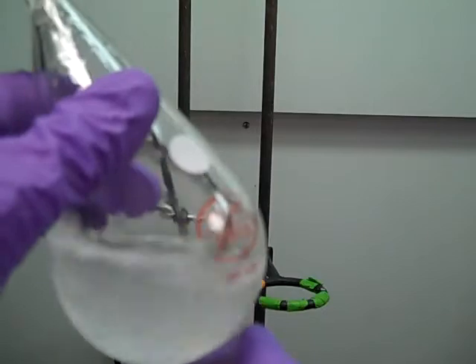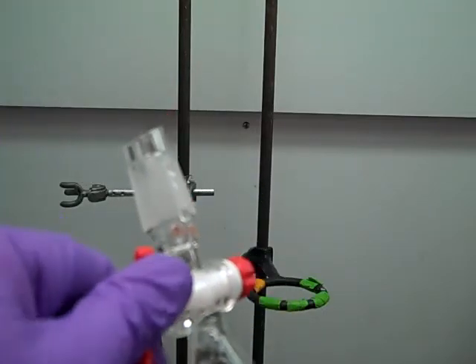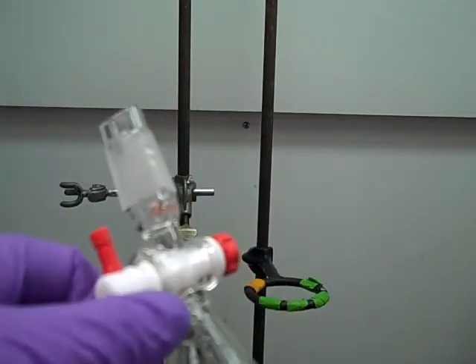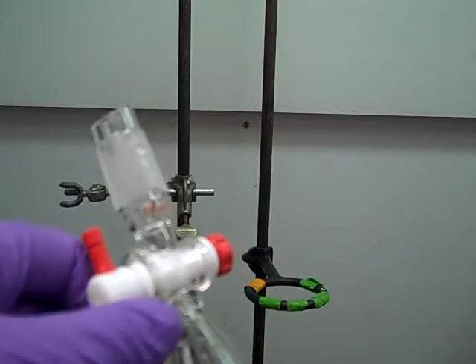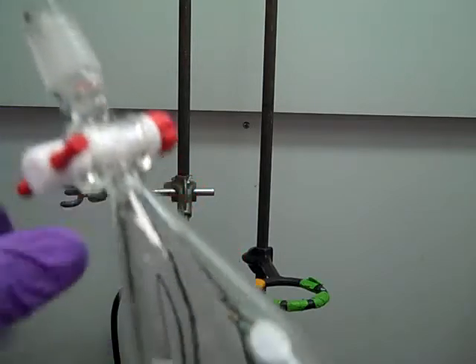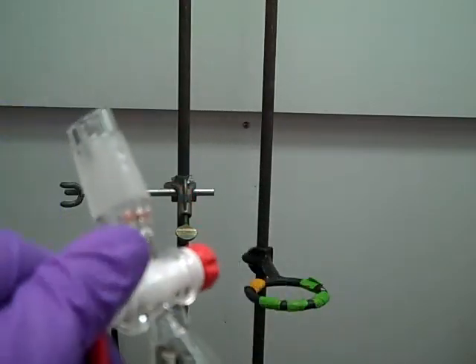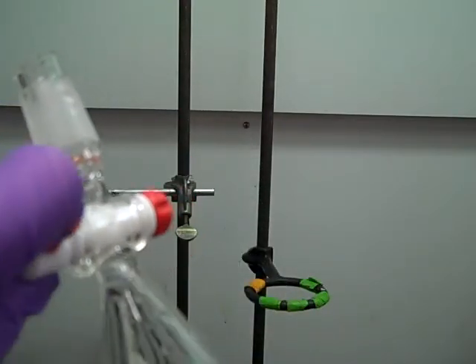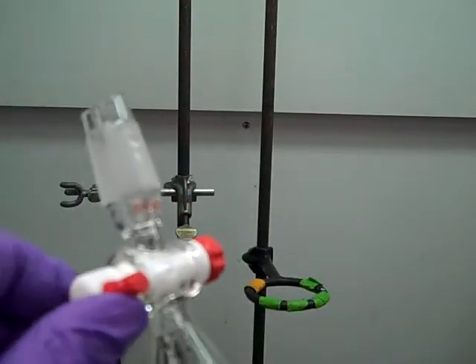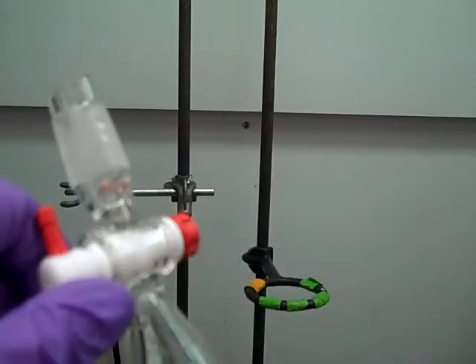So by shaking it harder and harder, we eventually are going to give a chance for all that organic and aqueous layer to interact with each other to let this separation take place. So we keep shaking it a little bit harder every time we vent. And then we're going to keep doing this until we eventually don't see any more bubbles coming out.